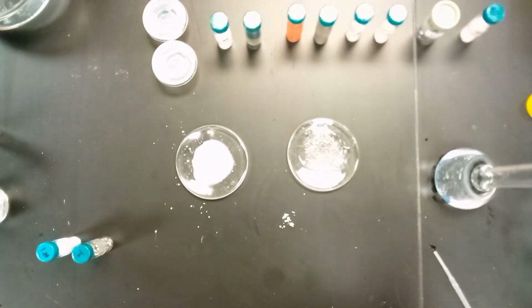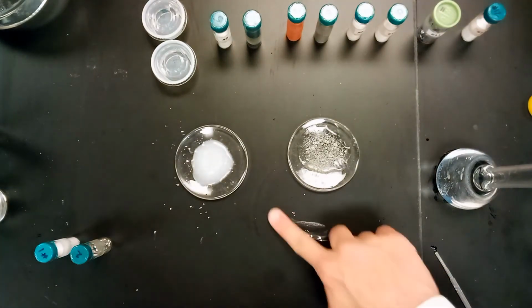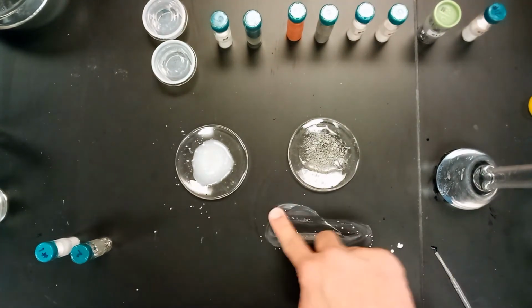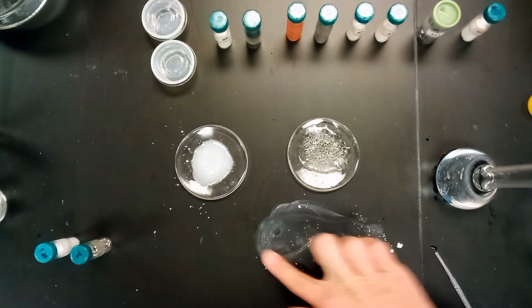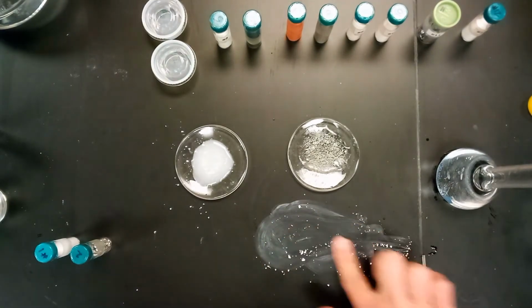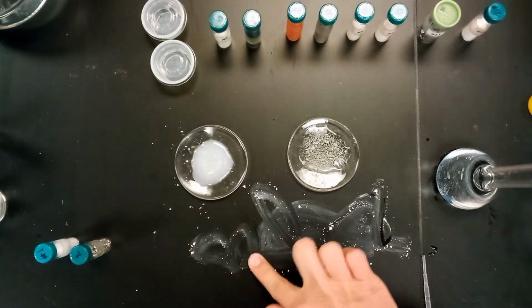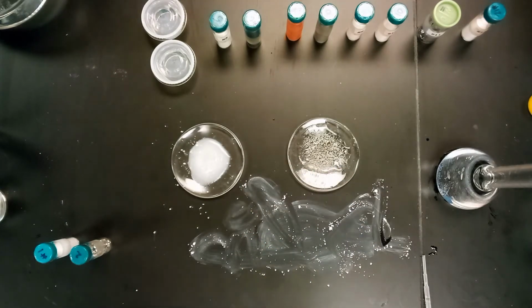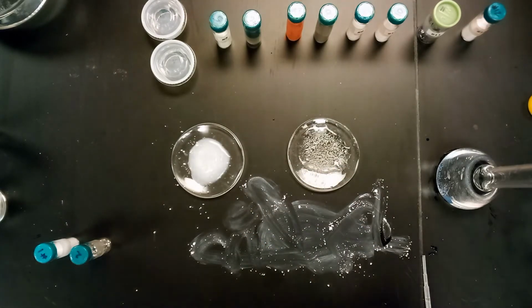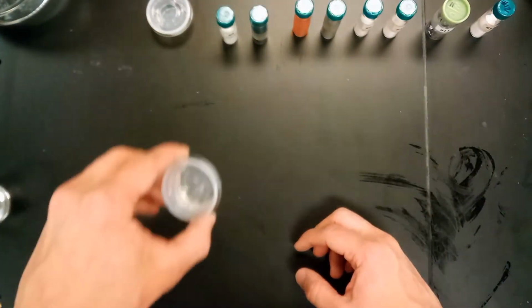But just to confirm our knowledge, I suppose, we'll just try writing on the table. You can see it's leaving a pretty distinct path, that if you were to write, say, your name or whatever with it, you can. So it's another big indicator for number 3. Hopefully that gives you some information on numbers 1 through 3.